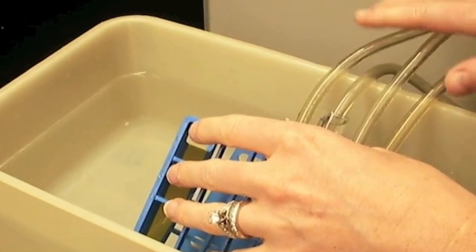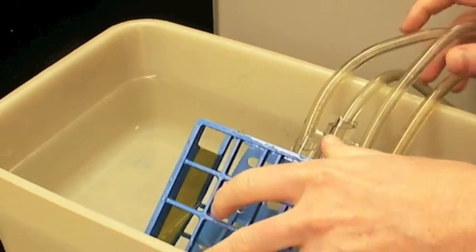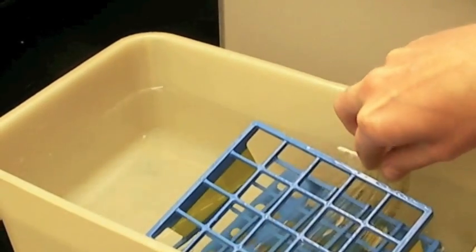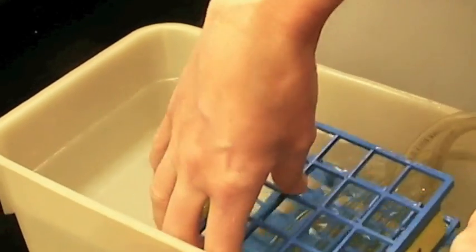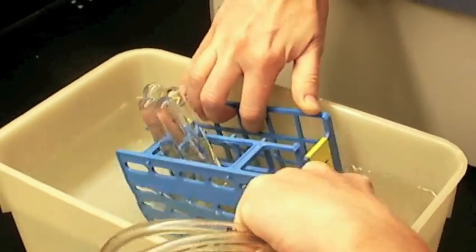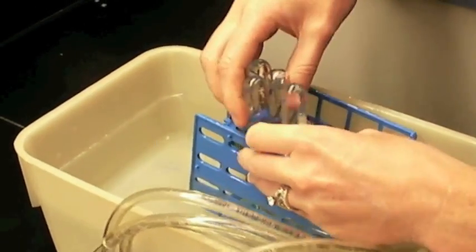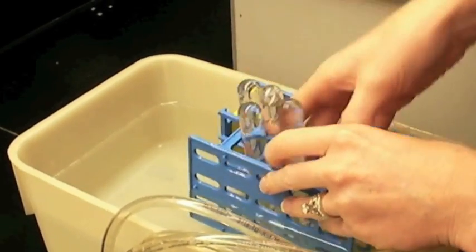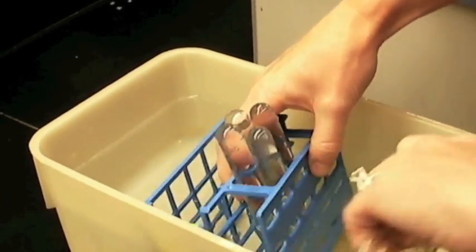Alright, once the tubing is in there, making sure it all stays underneath the water, you're going to flip the tubes so they are upright. And now I have test tubes with the tubes in them, and I'm going to turn this around to the side.